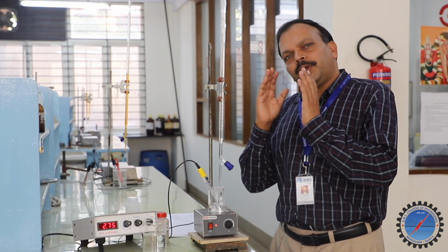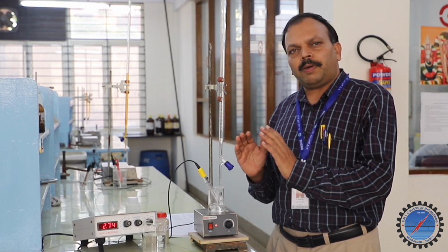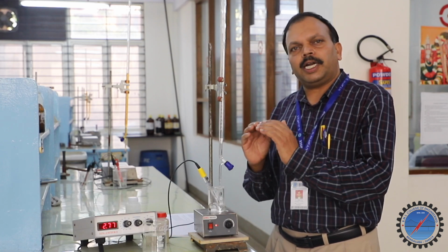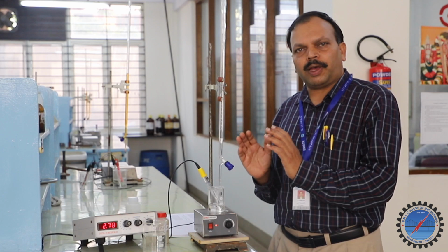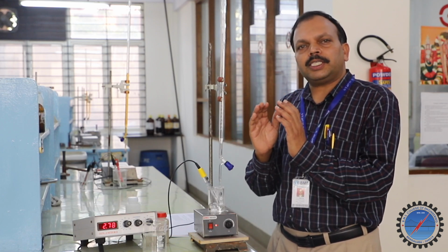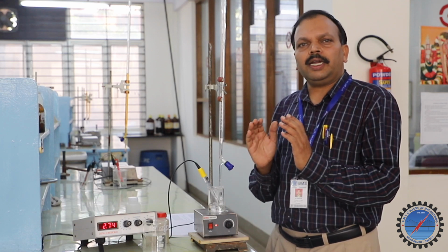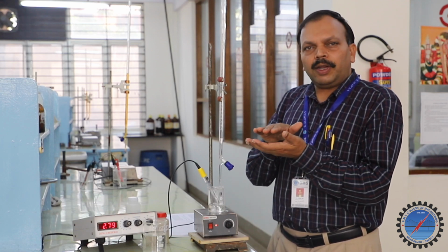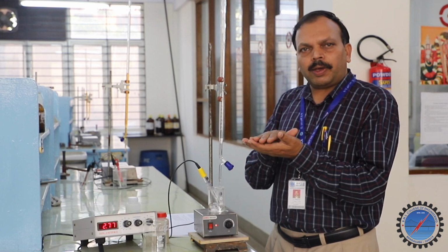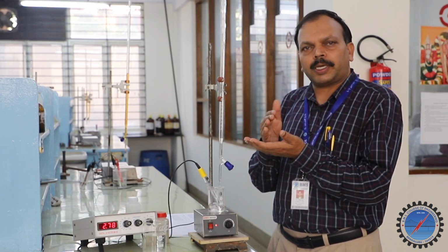Next, we are going to take delta V. Delta V is fixed. We are planning to add 0.5 ml throughout the experiment. That's why delta V is a fixed value of 0.5 ml. And in the final column, we are going to calculate delta pH by delta V. Delta pH we can also calculate: whenever we add 0.5 ml, there is an increment in the pH, and we subtract the previous value from it.